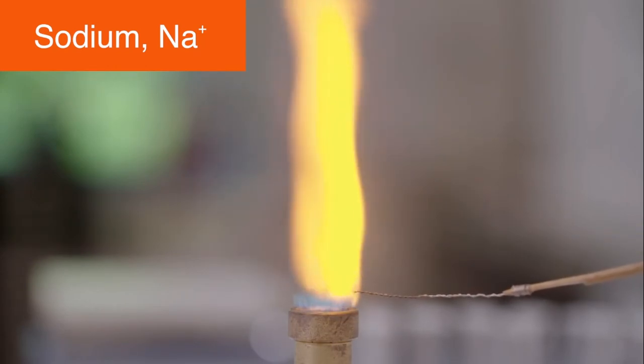Sodium produces an orange colour. Sodium is often used in street lights and is present in salt.